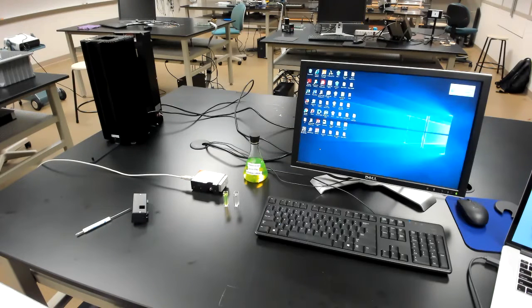All right. Now, let's examine the physical setup of the particle in a box experiment. This experiment will use almost exactly the same equipment that we used for the hydrogen atom spectrum experiment. Only now we're going to be doing an absorption measurement of a quite different sample instead of an emission experiment on an emission lamp.